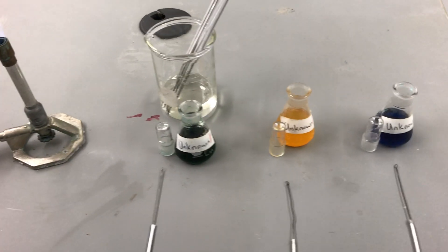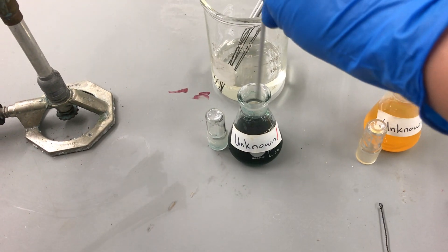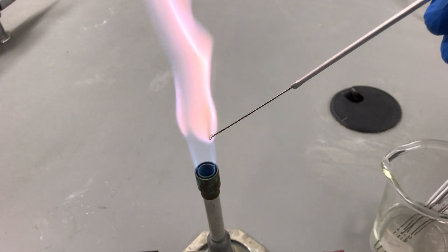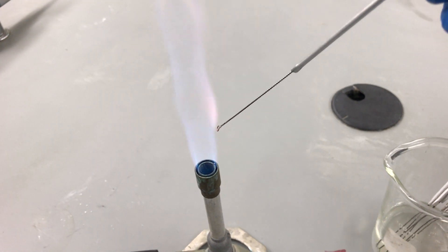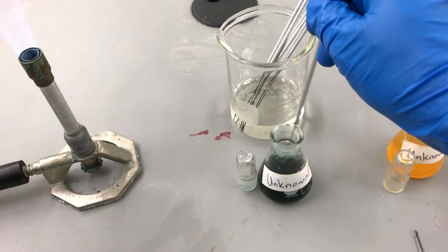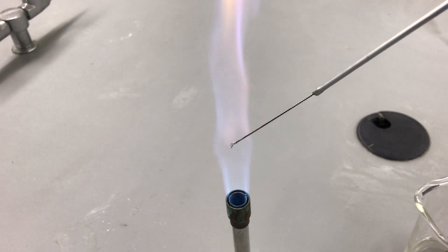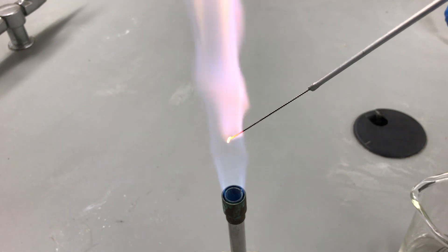We're going to start with unknown one. Remember the loop has already been decontaminated. Introducing it to the flame — and once again that beautiful lavender purple color. So unknown one burns a beautiful kind of lavender color. That's very, very distinctive. Based on that result you should be able to match unknown one with one of our known substances.